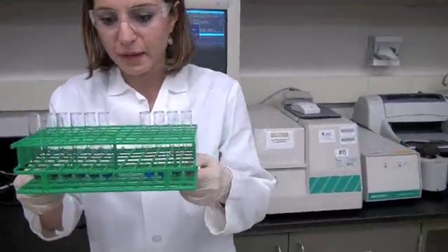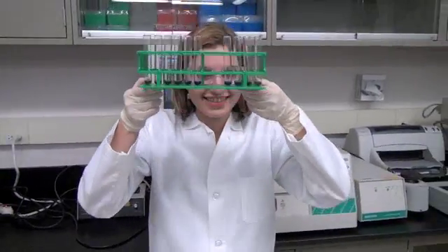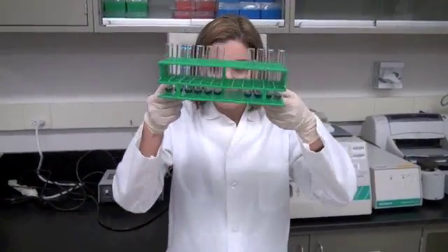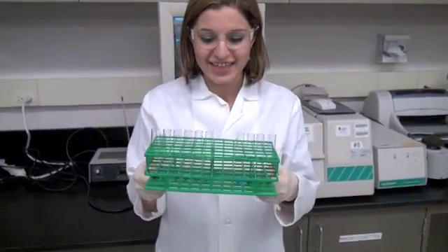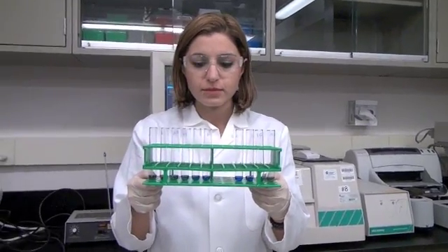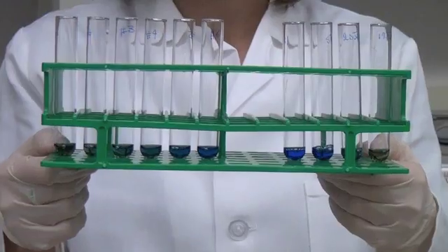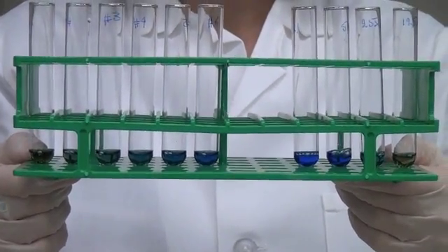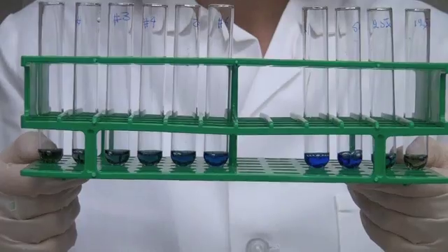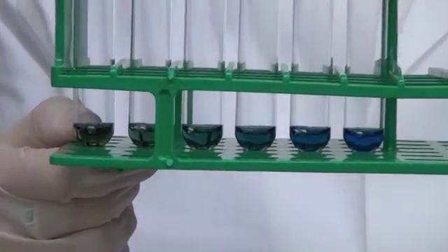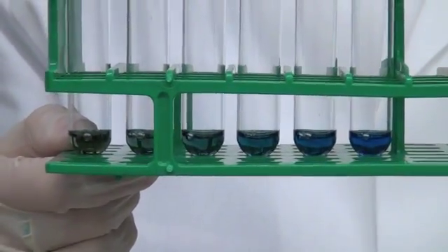With all samples incubated sufficiently in dye, you are almost ready to measure the absorbance. You must first, though, double check with your TA that your samples were made correctly. Look for two things: one, all samples have the same volume, and two, there is a corresponding gradient of color in both the standards and the dilutions.